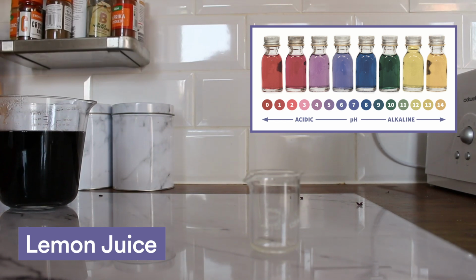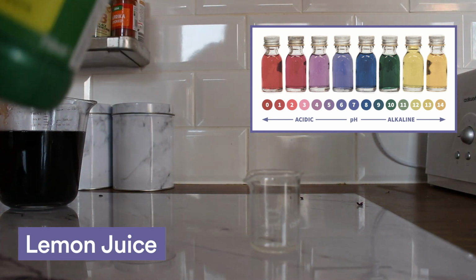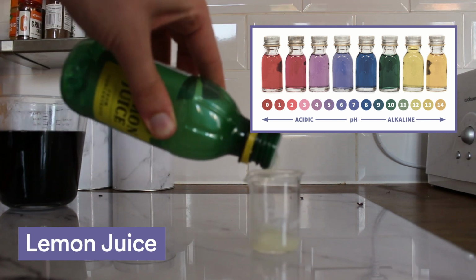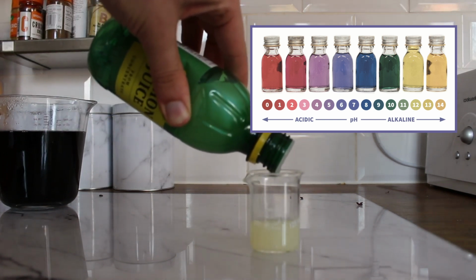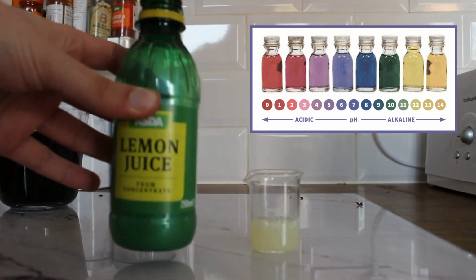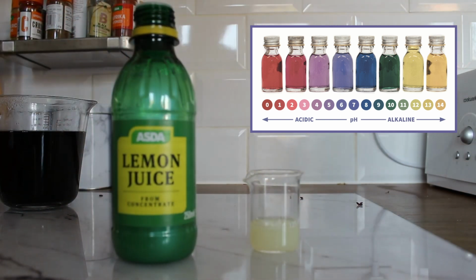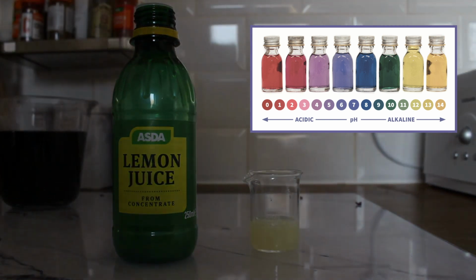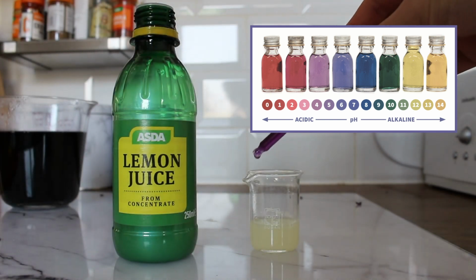In this experiment I'll be using lemon juice, so I'm just going to add a little bit of the lemon juice inside the mini beaker. Lemons are a type of fruit which are classified as citric fruits, and you might have heard of an acid called citric acid, which is inside lots of things like oranges and lemons and limes. So because of that, you might be able to guess what colour the indicator is going to go now.